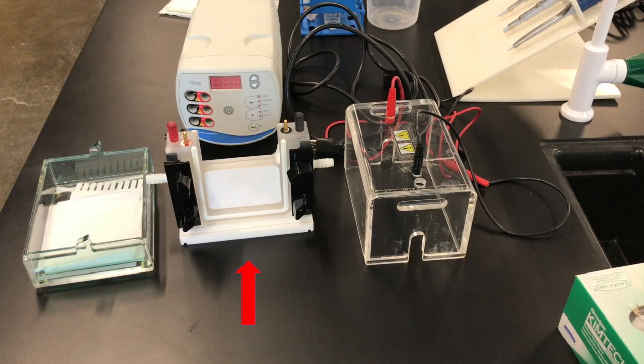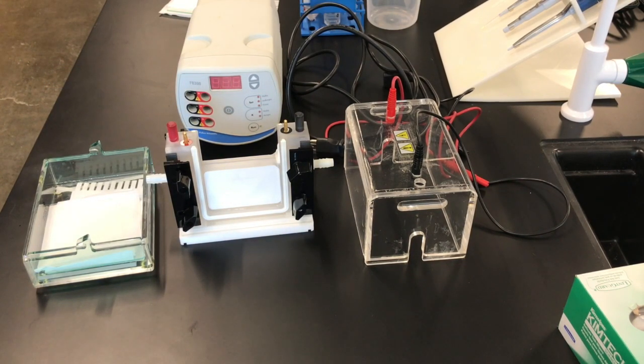You're also going to need the apparatus itself, a top cover, and a power supply. All these can be found in your electrophoresis drawer.